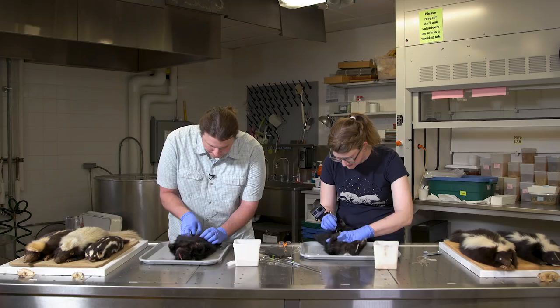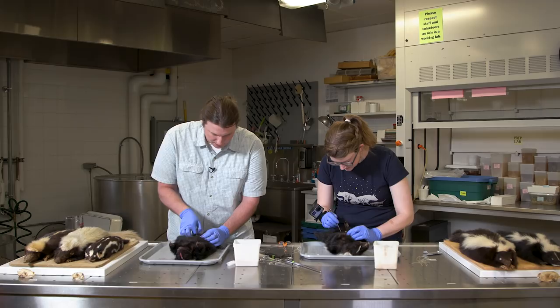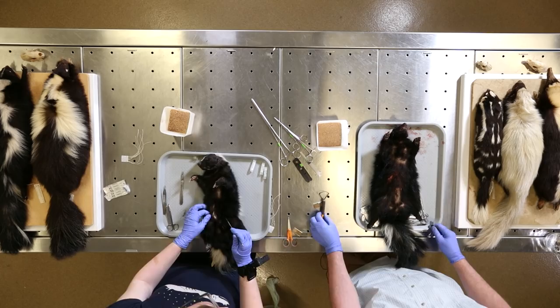She's really fat. Being fat means a little more work to get them prepared for the skin stage, because we have to use the fat scraper and get all the fat off the skin, otherwise it'll rot or grease out.